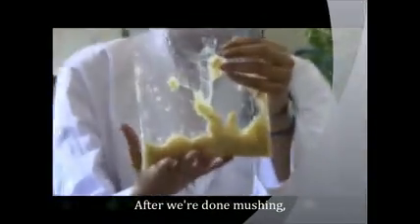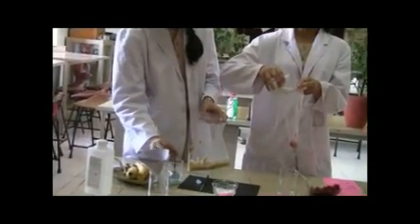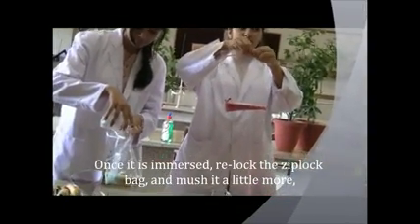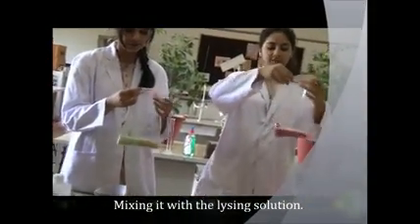After you're done mushing, we add the lysis solution which we prepared earlier to the mush. Once it is immersed, you re-lock the Ziploc bag and mush it a little more, mixing it with the lysis solution.